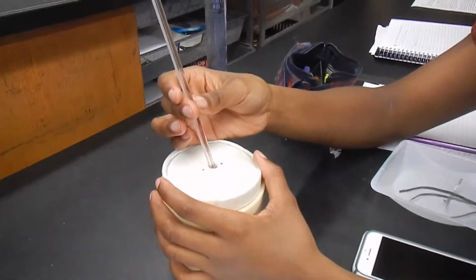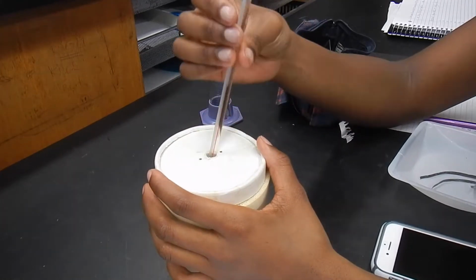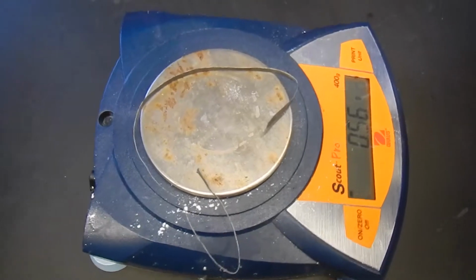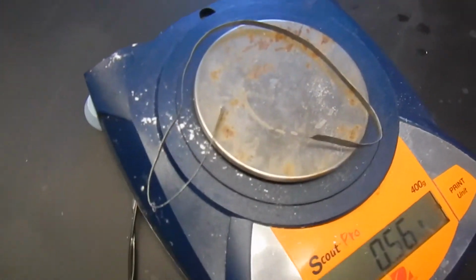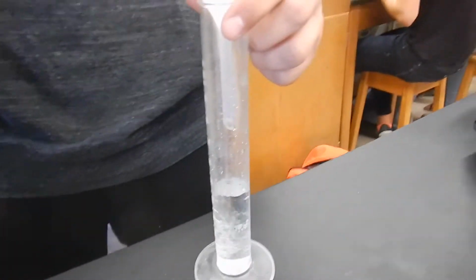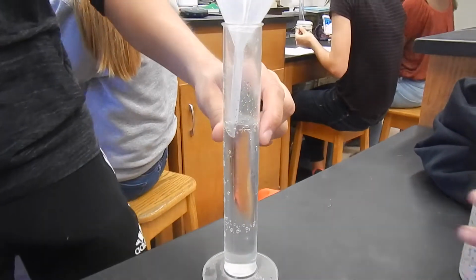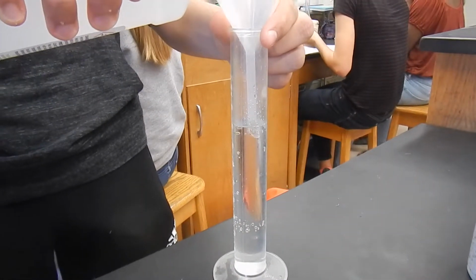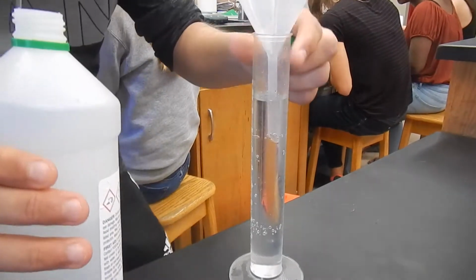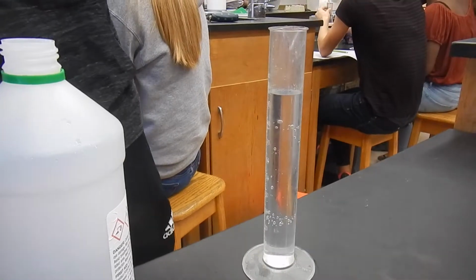You're going to take the temperature every 30 seconds for 3 minutes, just of the acid to begin with, and then every 30 seconds after you add the magnesium. Here's 30 centimeters of magnesium being massed. Another example of transferring the liquid, but of course only measure it when you take the funnel out, which is going to happen in a moment. There we go, and you can get the actual volume.